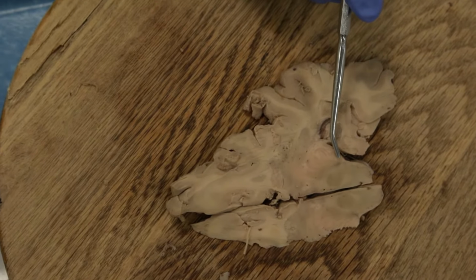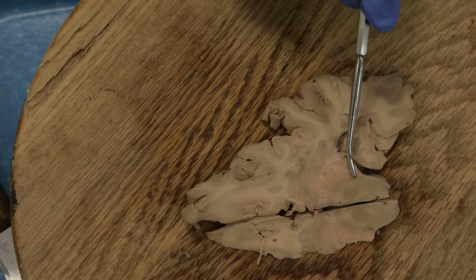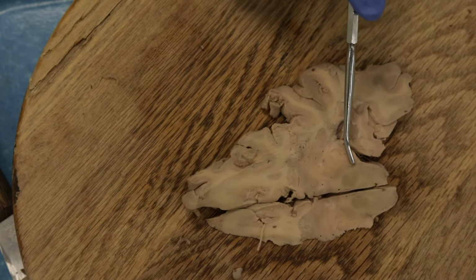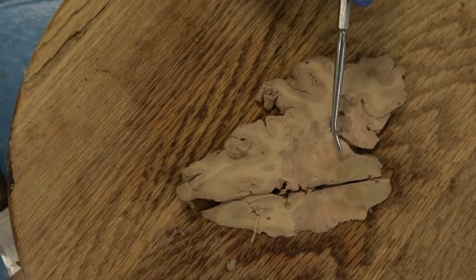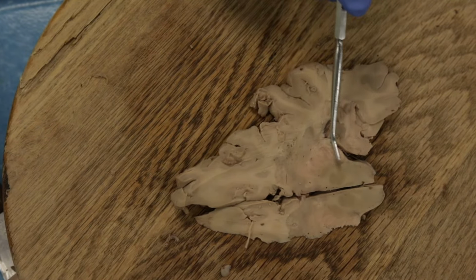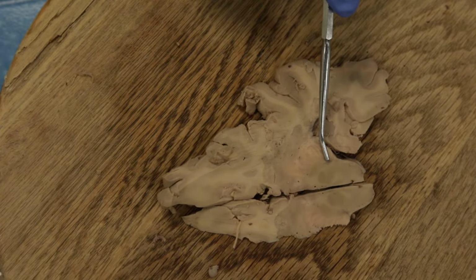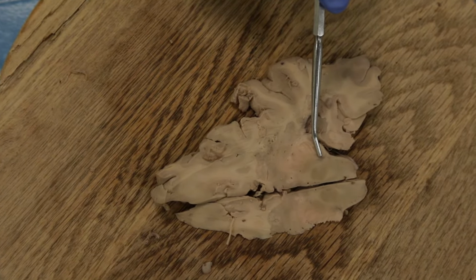Now notice in between we have some darker staining neurons here. So we're just seeing a little bit of the substantia nigra. As we go down lower, this should become larger. Okay, so dopamine is produced in the substantia nigra. So we keep coming to different parts of the basal ganglia. The substantia nigra is in the midbrain, so it's of mesencephalic origin, but in terms of function, it's part of basal ganglia circuitry. So degeneration here, we know, results in Parkinson's disease, a movement disorder.